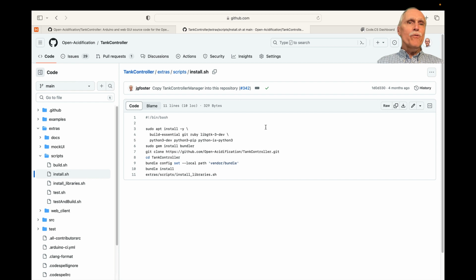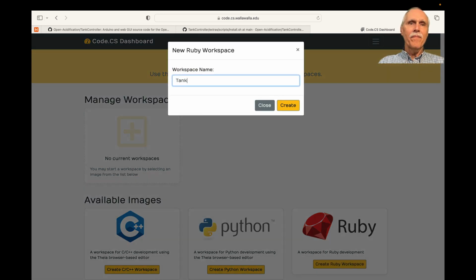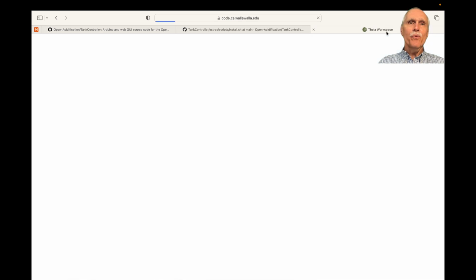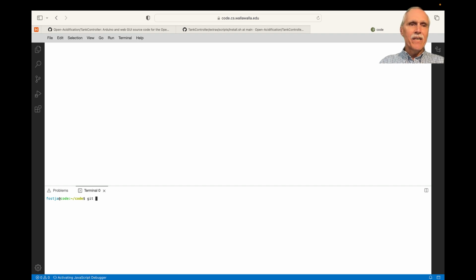This project requires a few things in your working environment: a C compiler, Git, Ruby, and Python, along with the gem bundler. I have an environment already set up with those things in an online IDE. So I will set that up, and then I will get a clone address. And within this workspace, I'll open a terminal, and in that terminal, git clone, paste. And that will clone the TankController project.